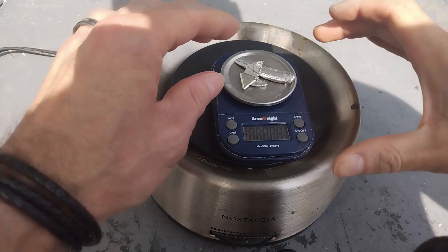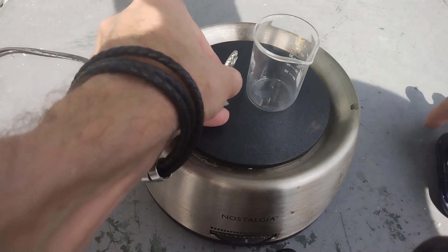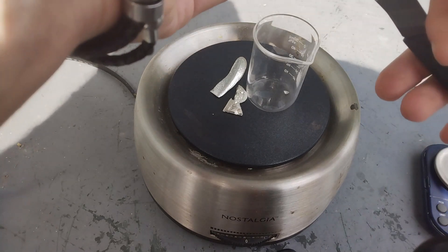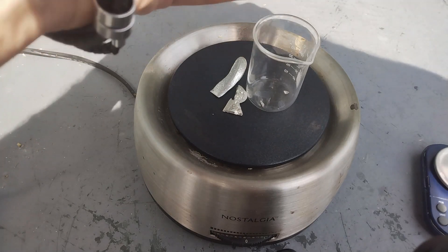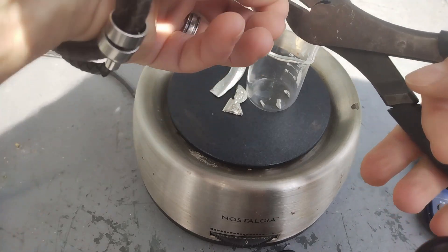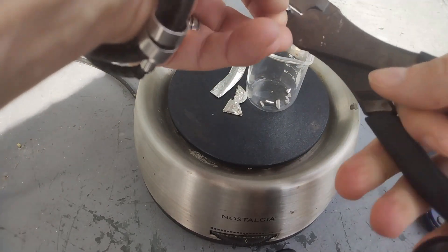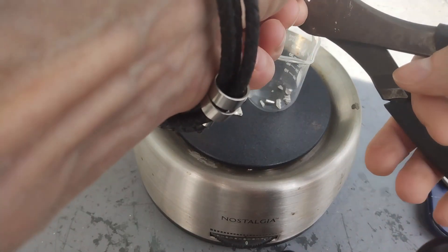Now I'm going to cut all those pieces into small pieces. That's to increase the surface of contact with the hydrochloric acid, because the reaction will be extremely slow and we want to improve it. A hundred small pieces have a larger surface than a single big ball.